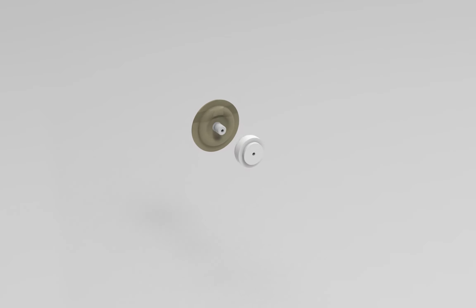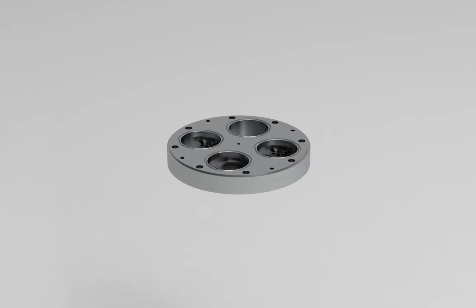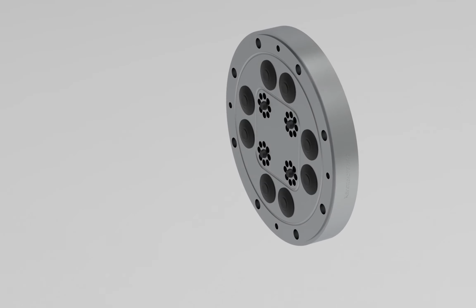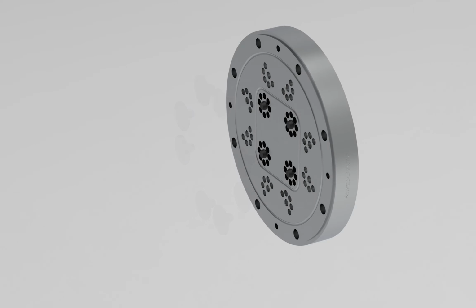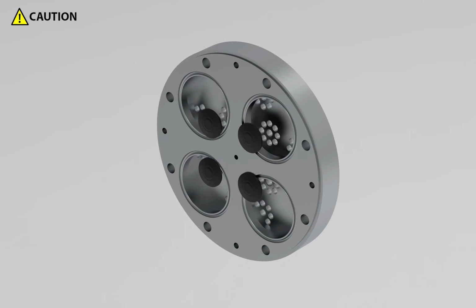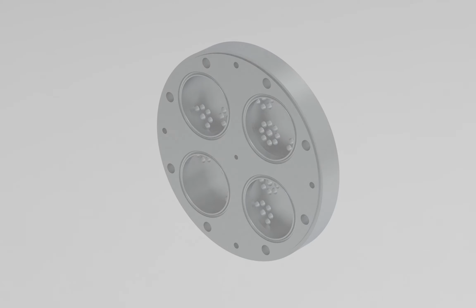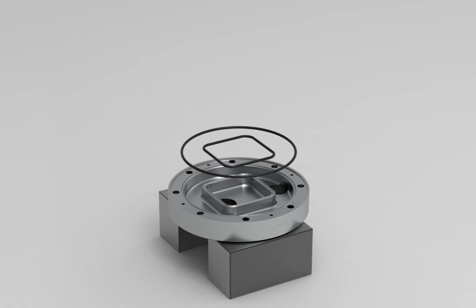Unscrew the diaphragm support. Remove the valve plate along with the valves. Hold the valve plate to pull out the inlet and outlet valves. Use pliers to pull out the valves on both sides. While pulling out the valves, please be careful not to damage the surface of the valve plate. Remove the O-ring and profile O-ring.